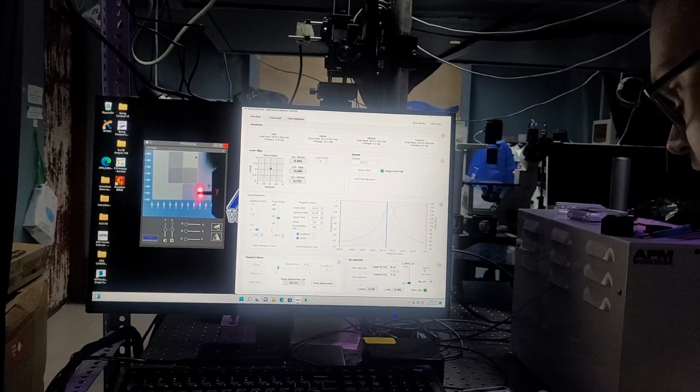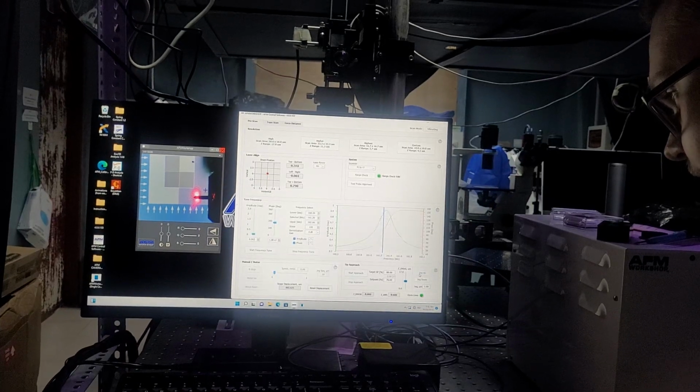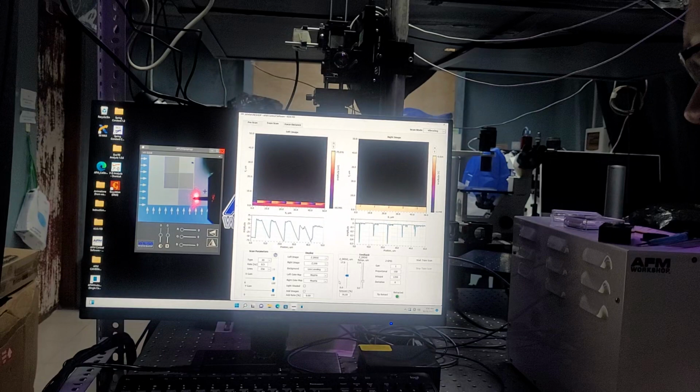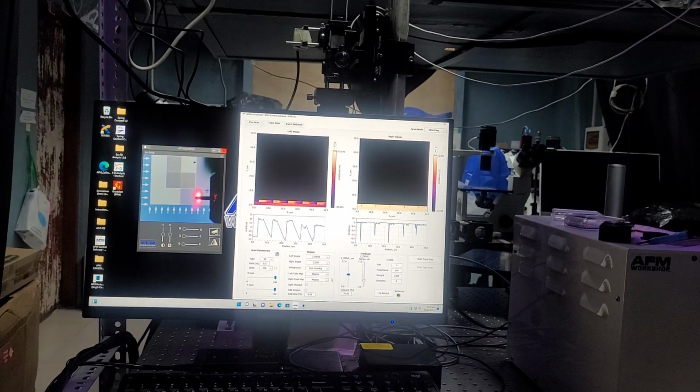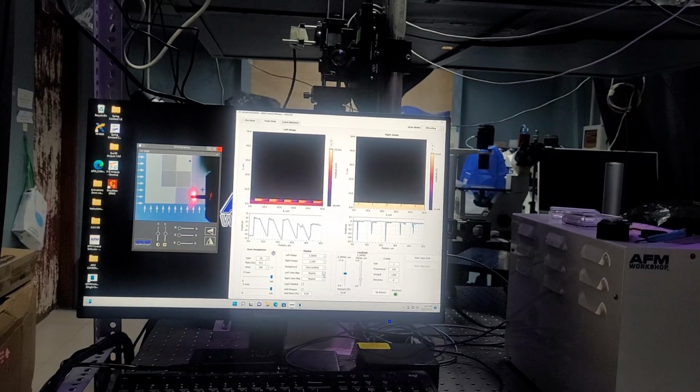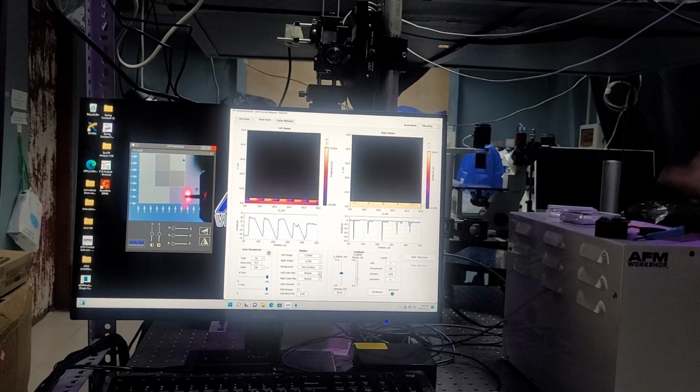Then you'll want to check your position, make sure that you're about halfway. In this case, I'm a little bit under. So I will just jog a couple of times, and we're right near the middle. It does not have to be perfectly, you just want it to be near that middle, both for the flexibility and for accuracy.